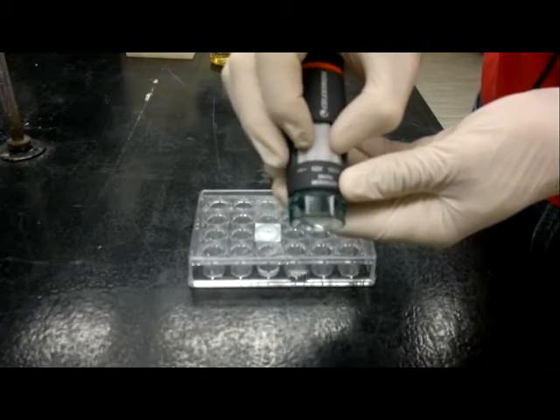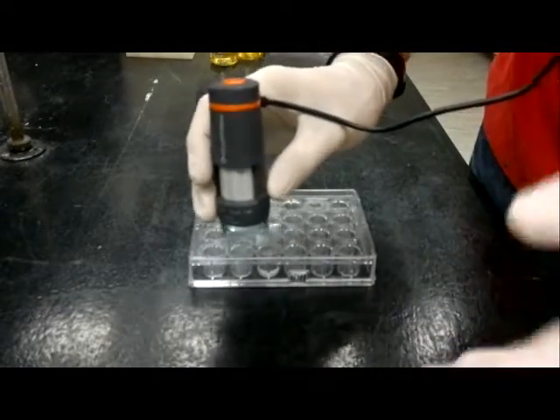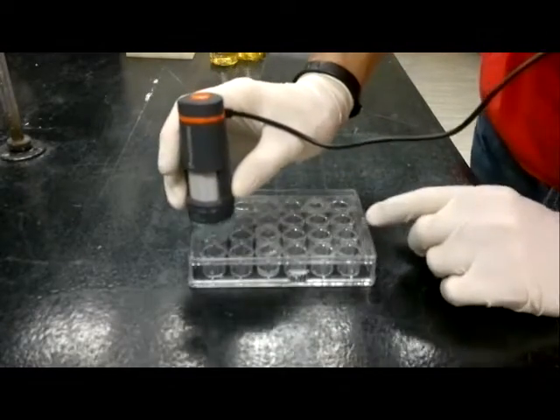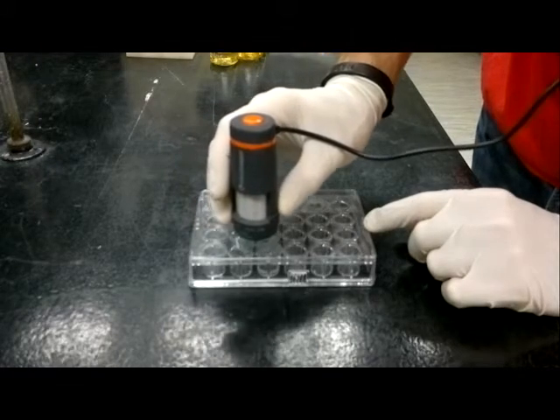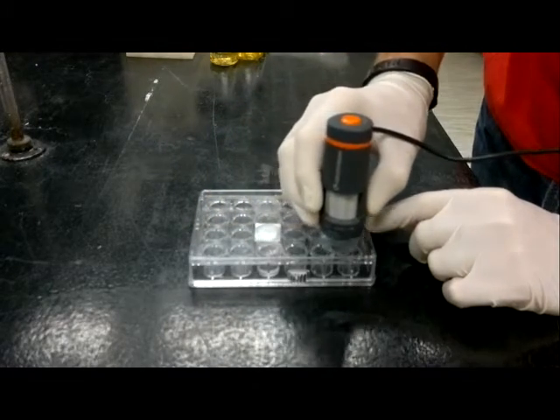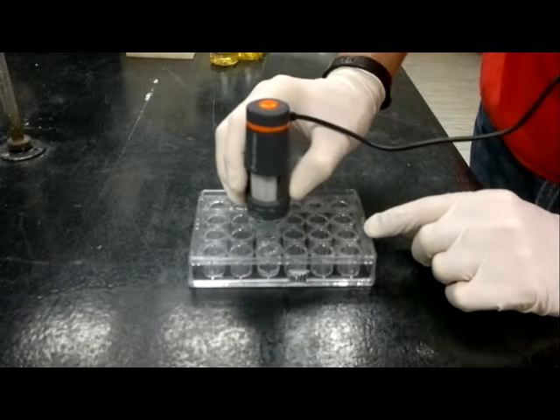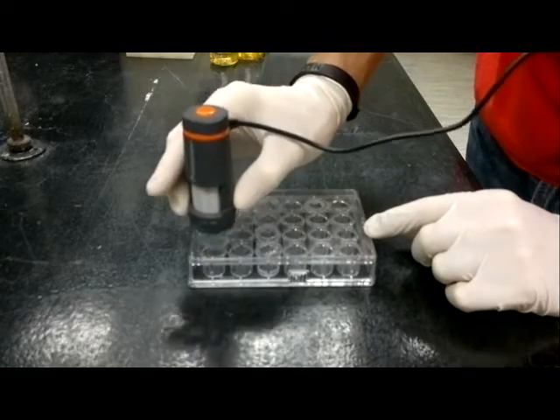This should be set up. You can actually run this along and check out drop by drop at a reasonably low magnification and identify which cover slips have potential protein crystals in them. So I would recommend doing this first. It's a big time saver, actually.